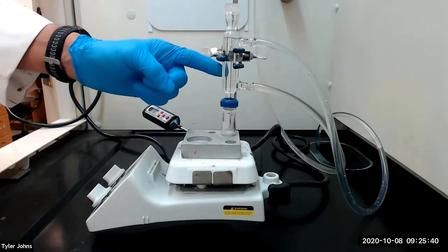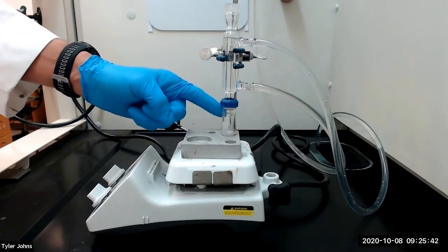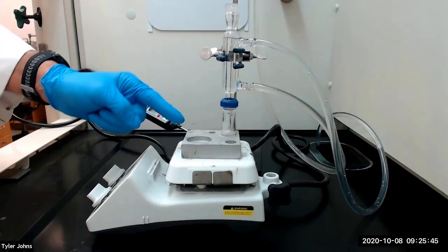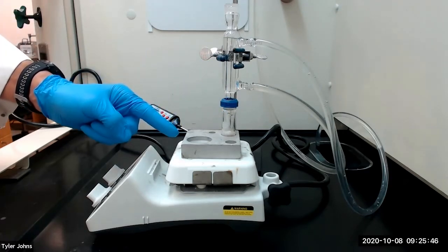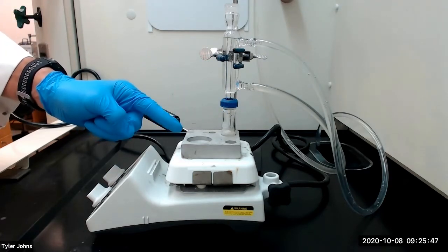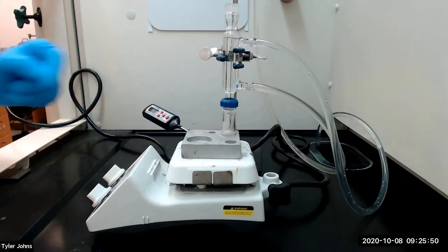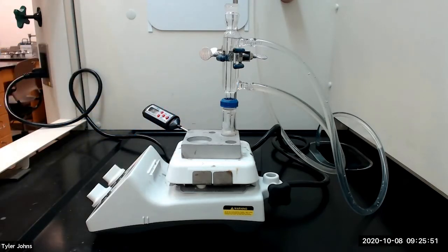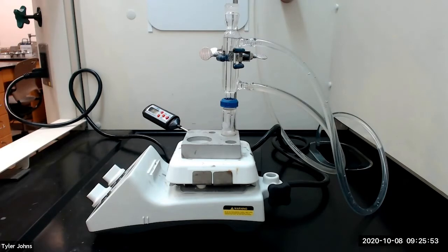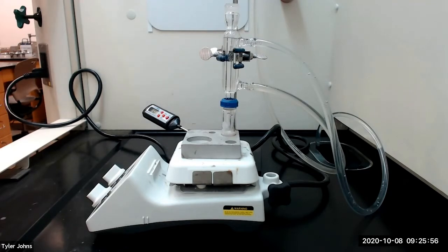We have attached a water-cooled condenser to our 5 milliliter conical vial with our reaction mixture. We will now heat the reaction mixture with an aluminum block at about 120 degrees Celsius and stir gently. After the solid has dissolved, we will heat the mixture for an additional 20 minutes to complete the reaction.